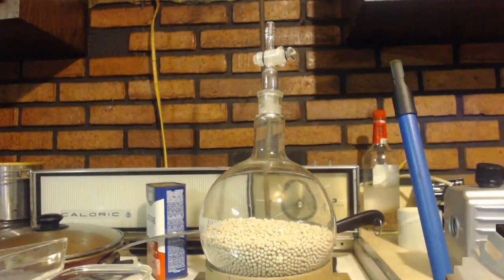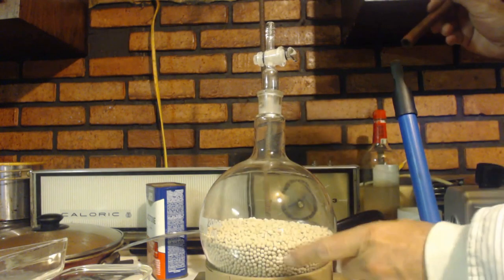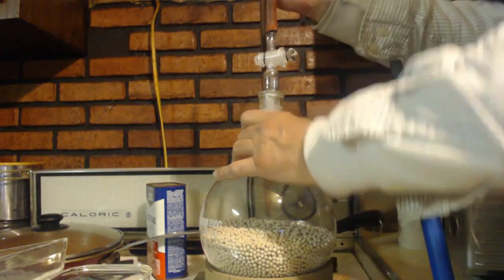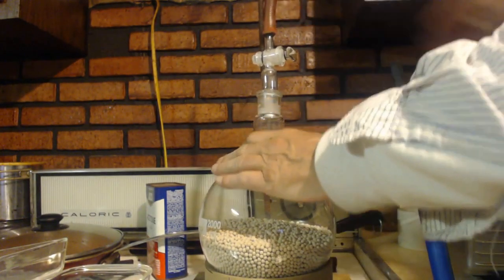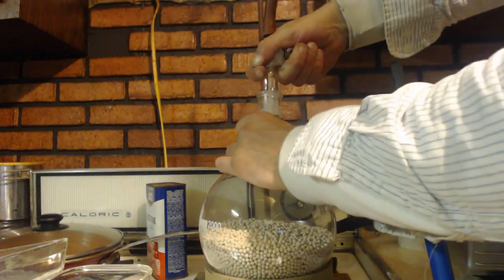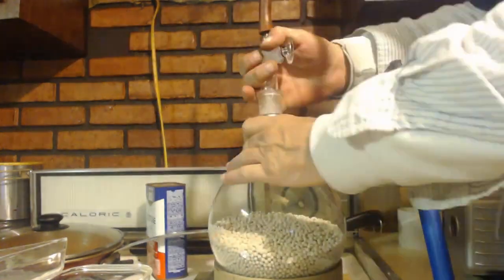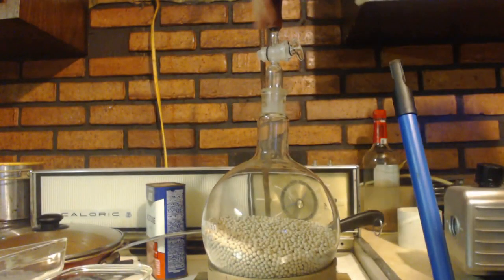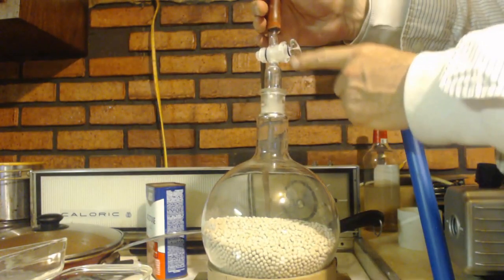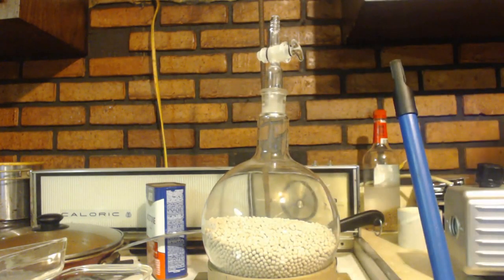So there we go. Well, that's pretty much it. I put them all into this flask here and you can see that I got a valve on there. Put this hose on. That's it. Now I got a vacuum on there. Closed up the valve. Now I can store this and it won't get water all in it.